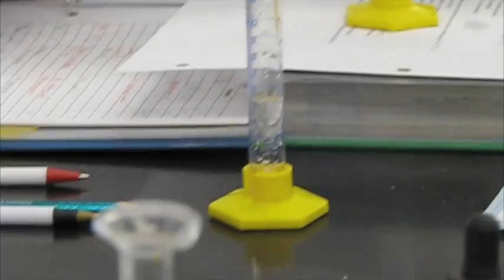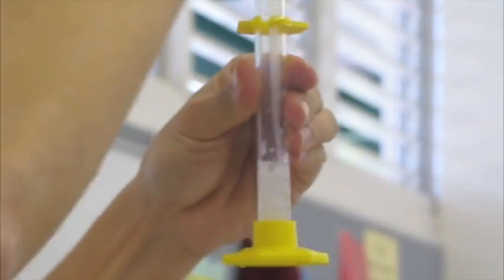But because the cracker is all on top, I need to mix it. I'm going to take a pipette and I'm going to froth it up. I'm going to mix it in so that the amylase and the lipase have a chance to do their job.